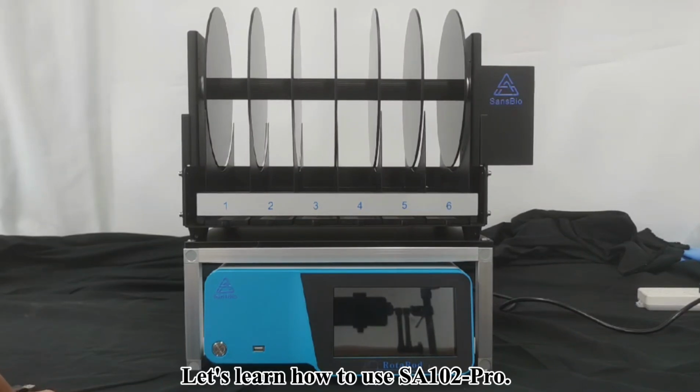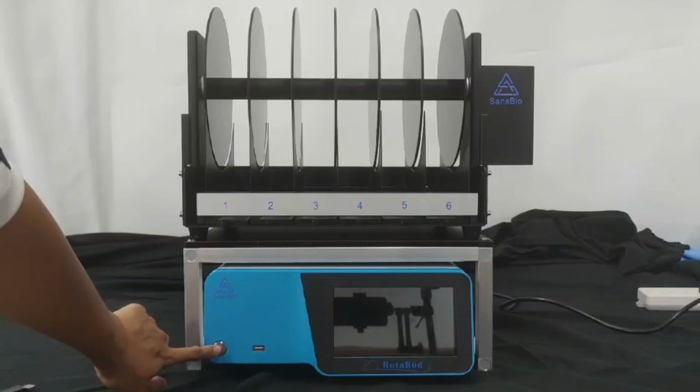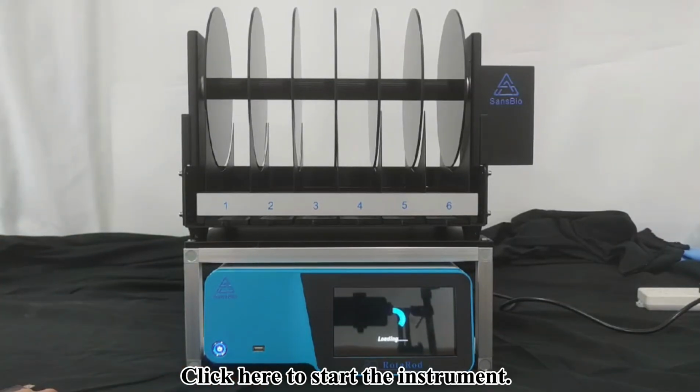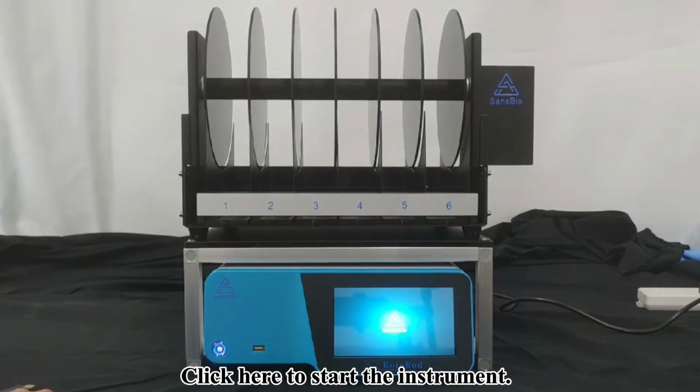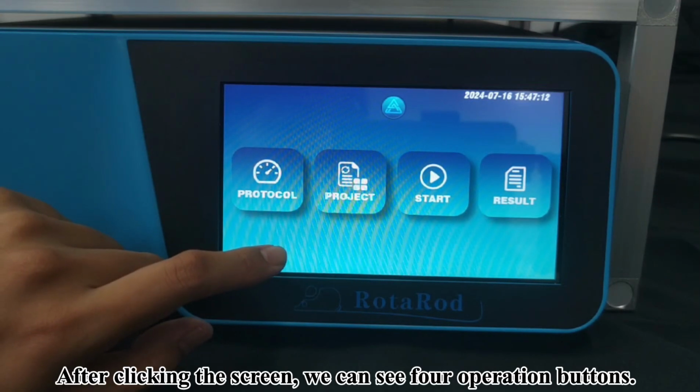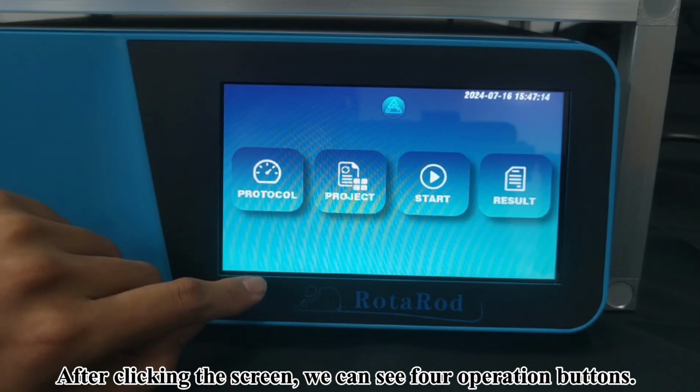Let's learn how to use SA102 Pro. Click here to start the instrument. After clicking the screen, we can see 4 operation buttons.